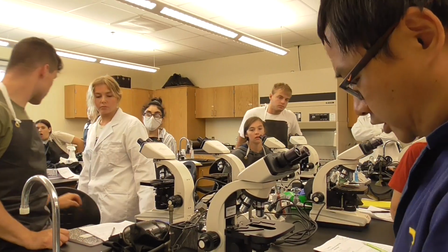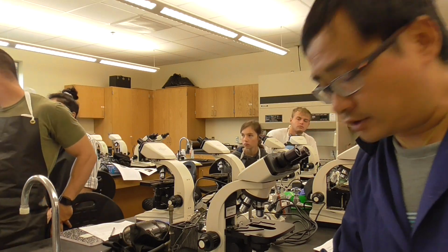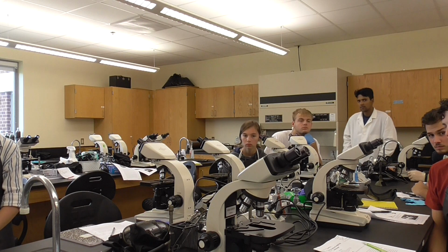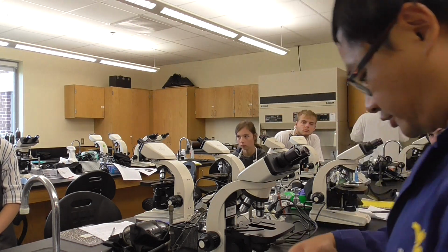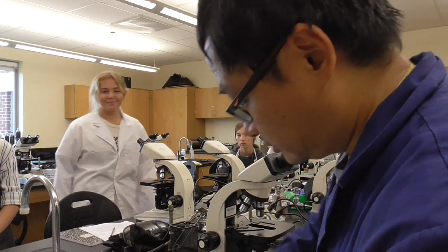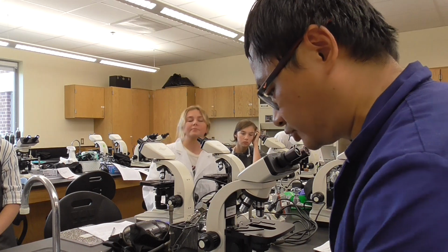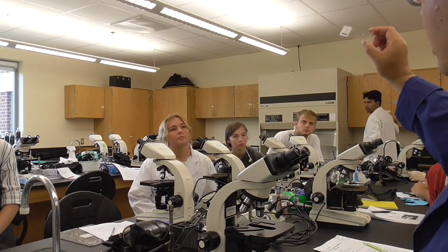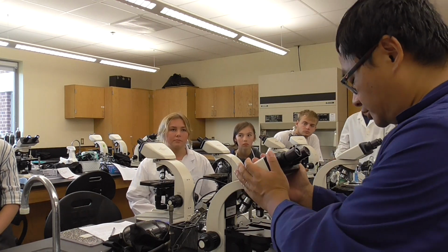So today's work, we will be using prepared slides, where the bacteria is already there. So let's say you have a Staphylococcus aureus right there. And we're going to pick one. Okay, we have all these. And another one is the budding yeast. So right here you can see it, stained with crystal violet. So how to do it? This is the microscope.